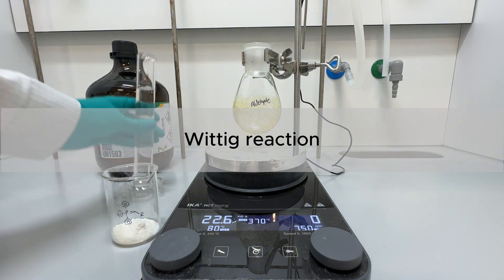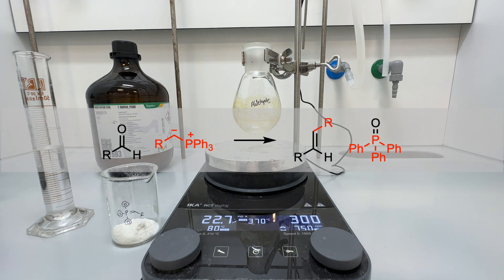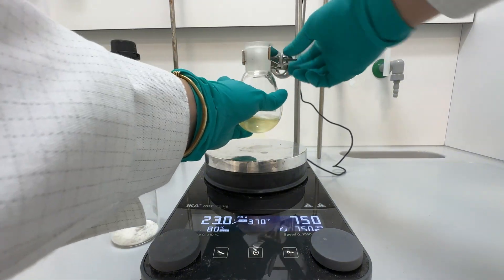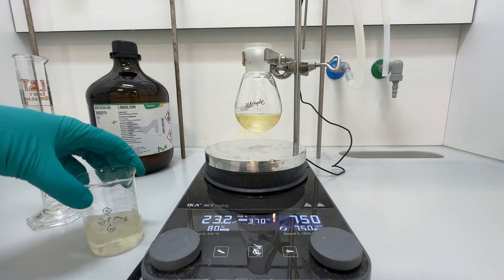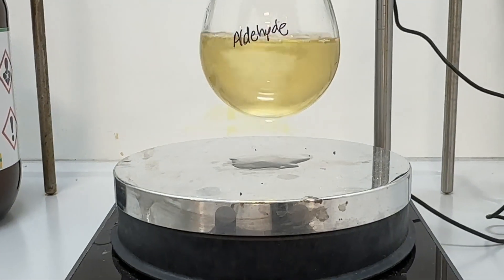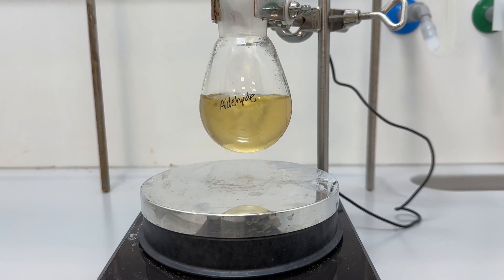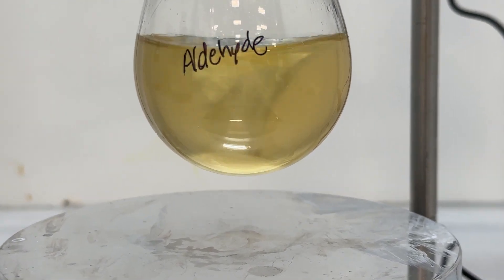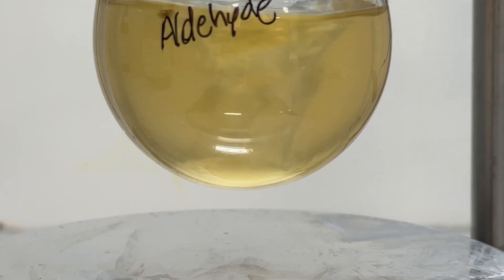Finally, our last step was the Wittig reaction. To a round-bottom flask containing the aldehyde and a magnetic stir bar, we added DCM and switched on the stirring. Once the aldehyde was completely dissolved, we added a solution of the ylide in DCM. My assistant was setting up the reaction, and being a bit nervous because I was recording from a very close distance, she accidentally spilled some of the reagent out of the flask. This shouldn't happen, but it was not a significant issue because we were using an excess of the ylide. Besides, this kind of accident sometimes happens, and it's important to adapt and know how to act when facing unexpected situations.